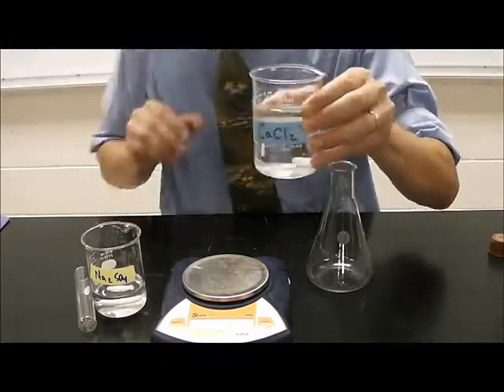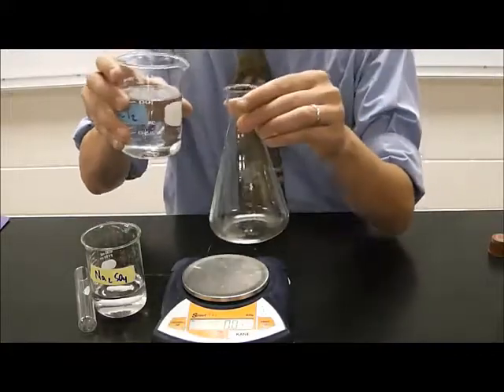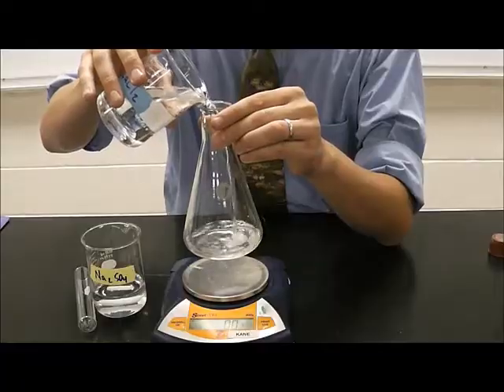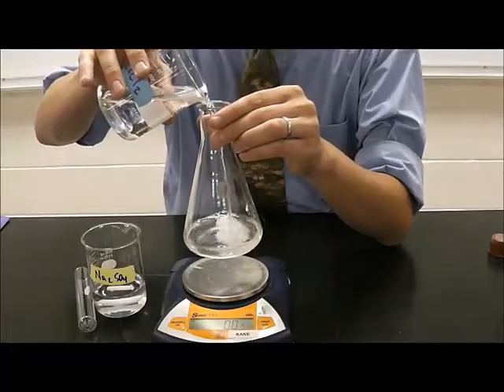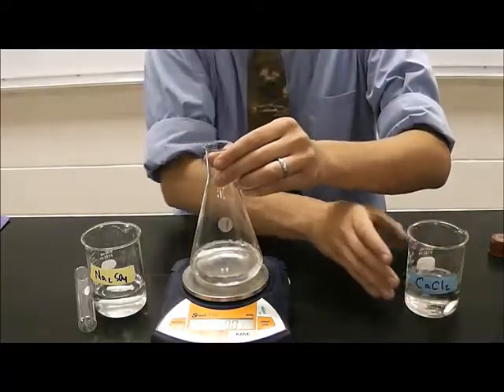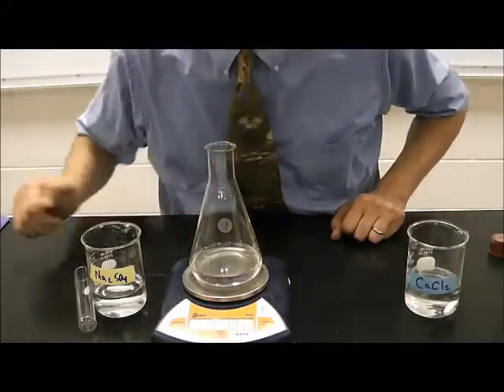I've got some calcium chloride here, which I'm going to use to place in the Erlenmeyer flask. Exact amounts are not necessary in this demonstration, so that's probably about enough. Place that on my balance here.